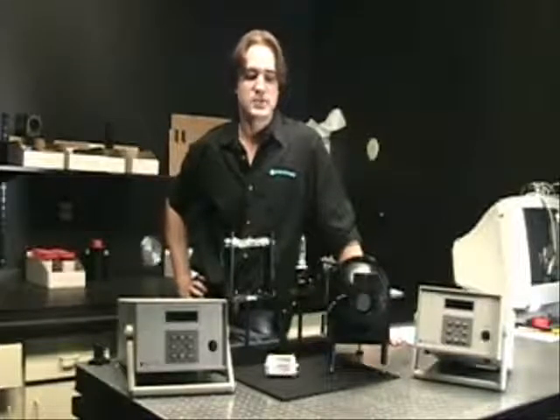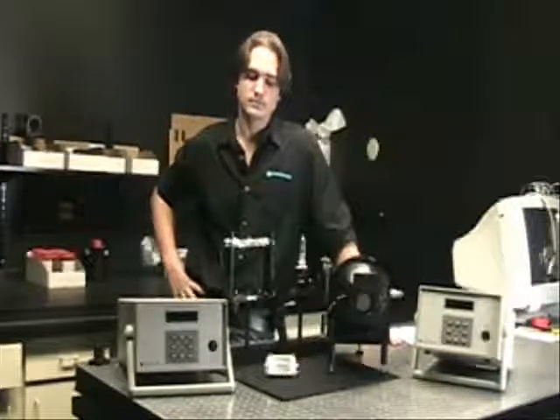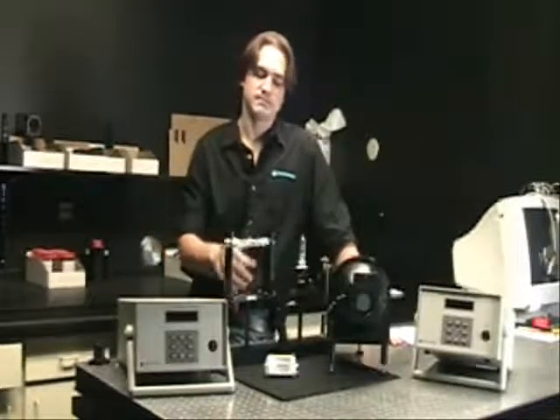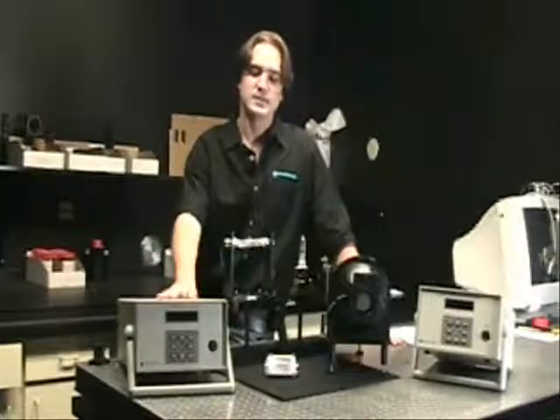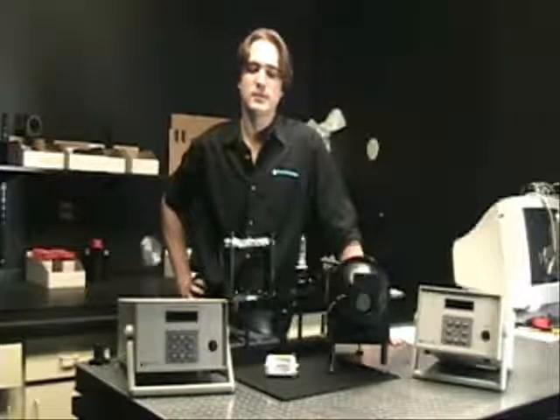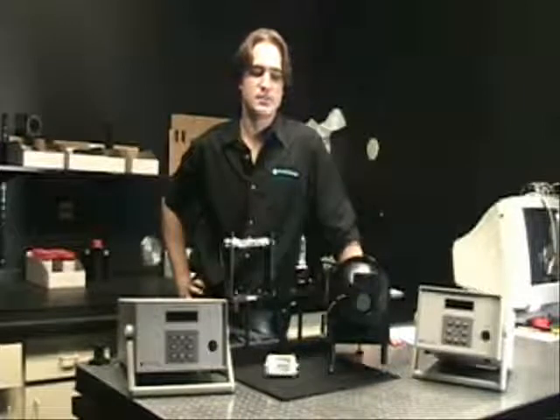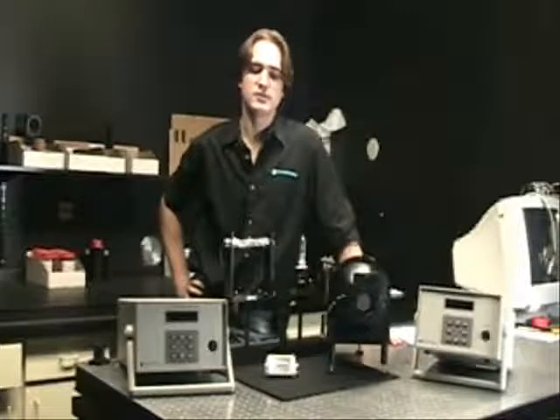In order to operate a calibrated lamp source, a precision current supply is required. This is because a small deviation in current can lead to a large, spectrally-based deviation in your calibration. The current supplies we offer provide a wide variety of methods, such as the ability to store data and record individual use hours for multiple lamps, as well as the ability to provide a controlled ramp-up and ramp-down of the lamp current, which increases the usable lifetime of the lamp by minimizing the risk of damage to the filament when current is introduced too quickly.